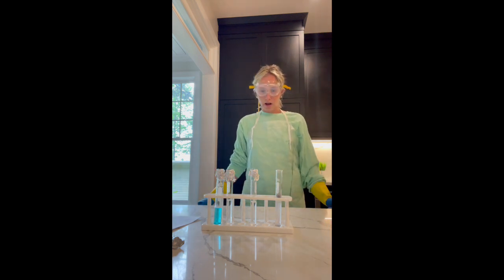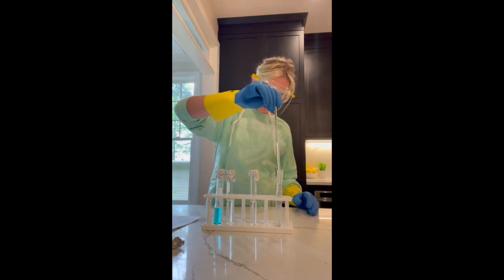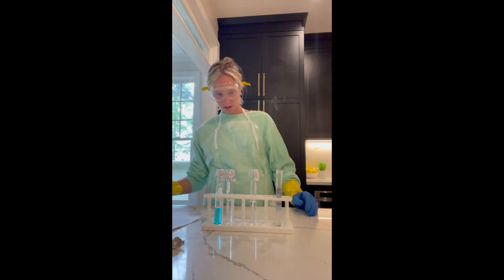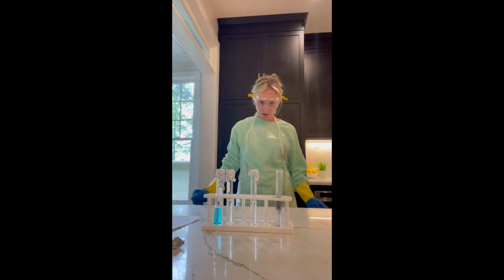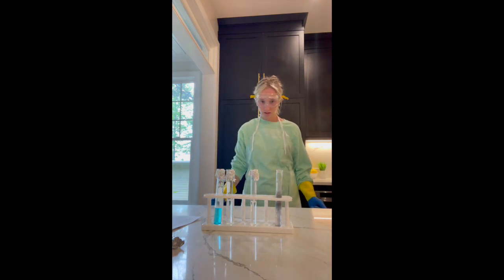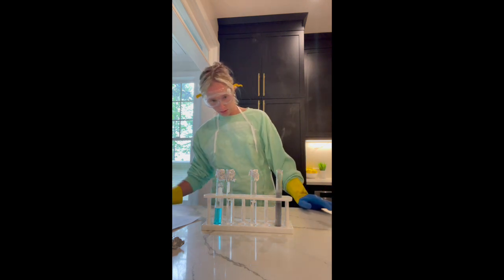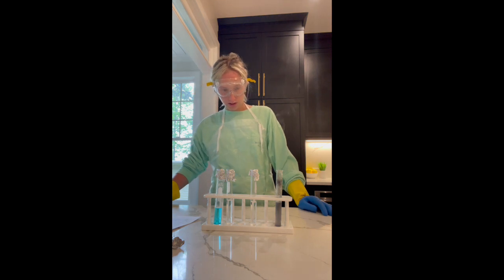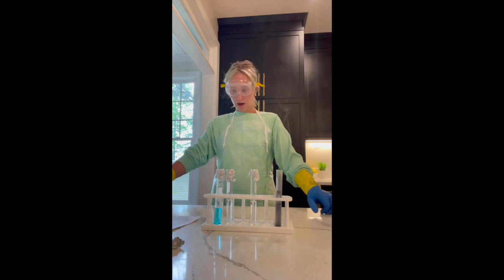Okay, so while that's still happening, I'm going to push the aluminum back down. Yeah, when you push it back down, it just goes right back up. Okay, so the water did turn a little murkier, definitely, and it's still smoking. Okay. Yeah, now it's like a gray liquid color. So I'm just going to keep watching this until I believe it's done, and then we'll move on to reaction 4.